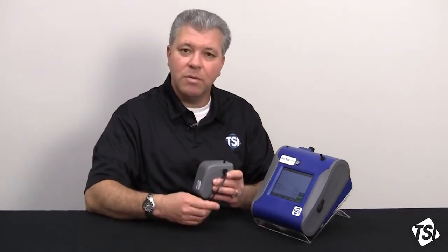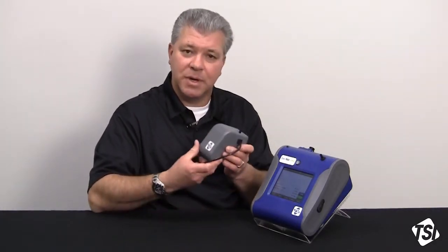Another reason would be temperature and humidity variations that can take place during the day, especially for outdoor environmental monitoring. It's cooler in the morning, humidity may be a little bit lower, temperatures rise during the day, and humidity may rise or fall. So you really want to be able to zero out those influences during your sampling period.